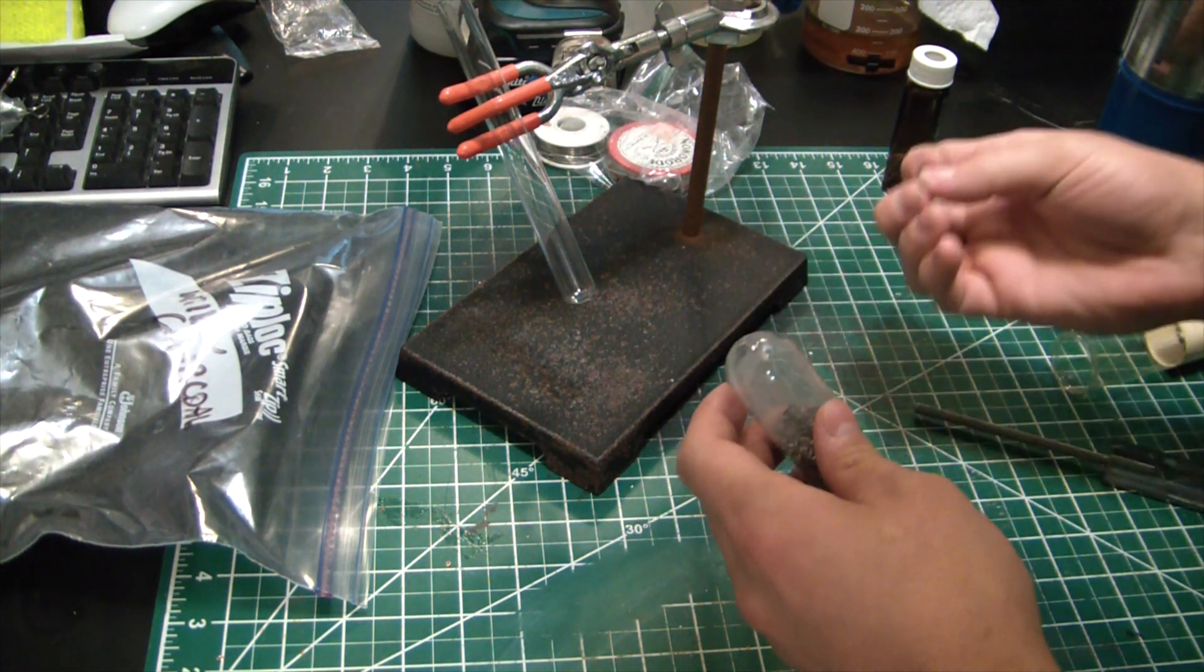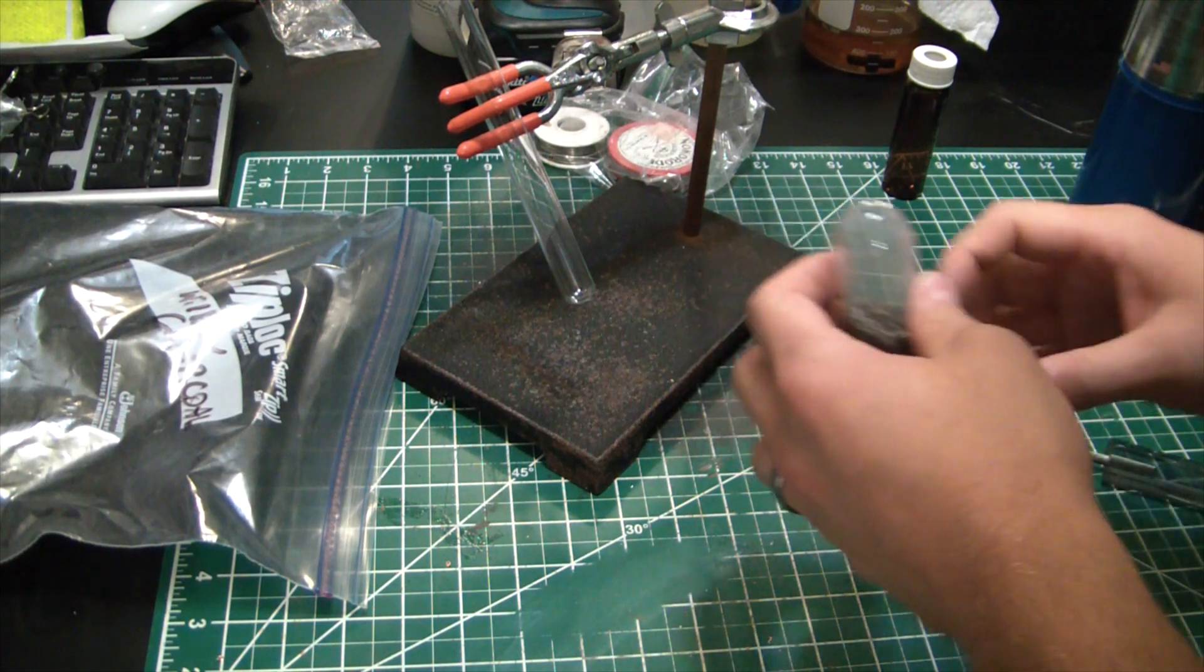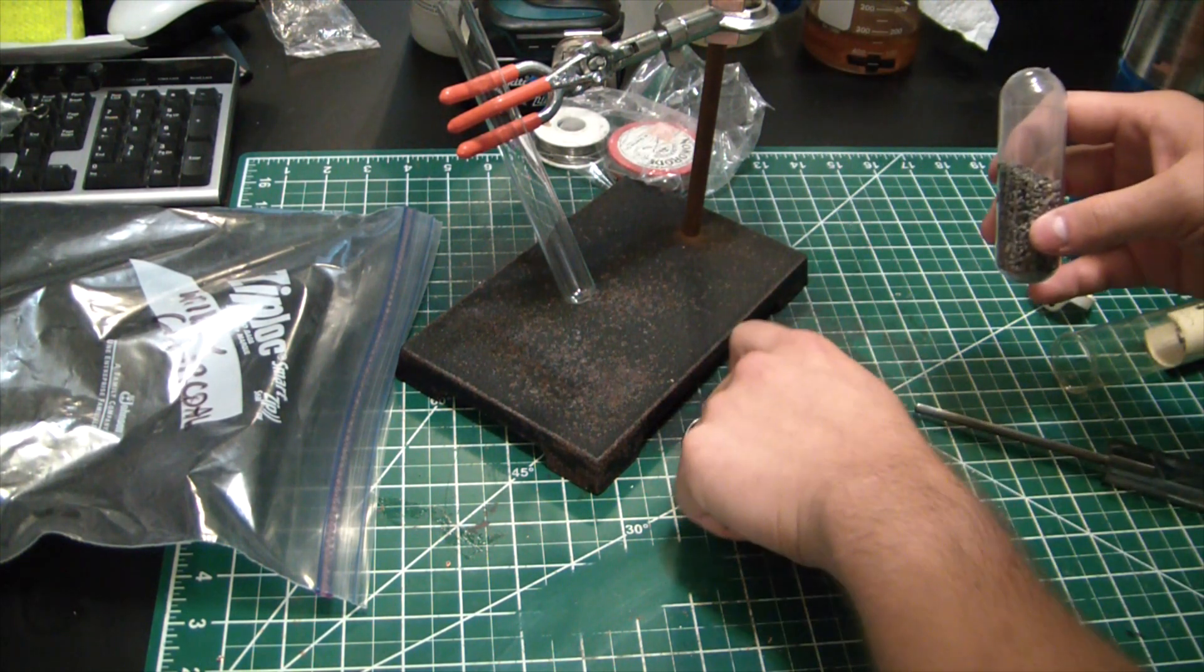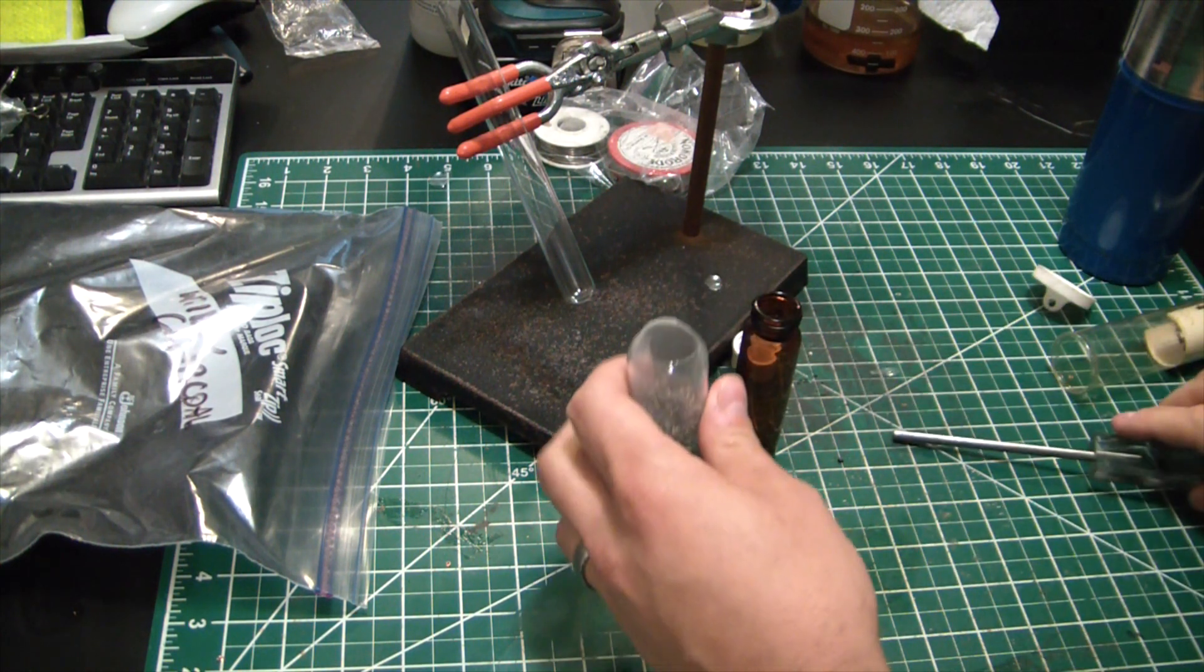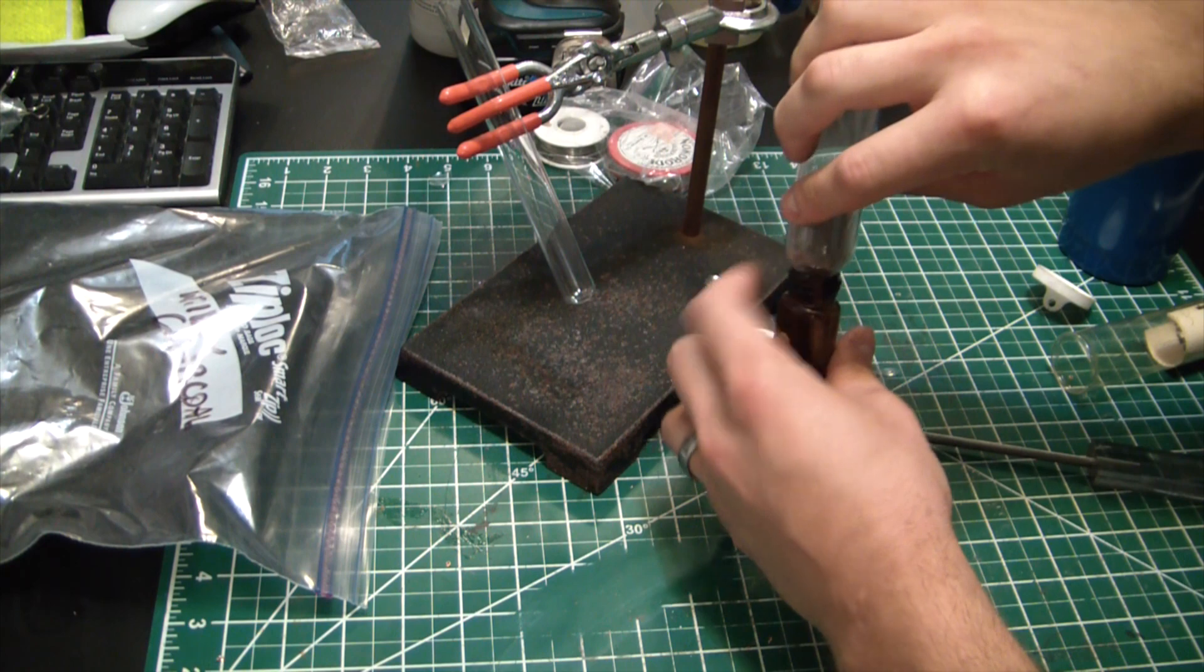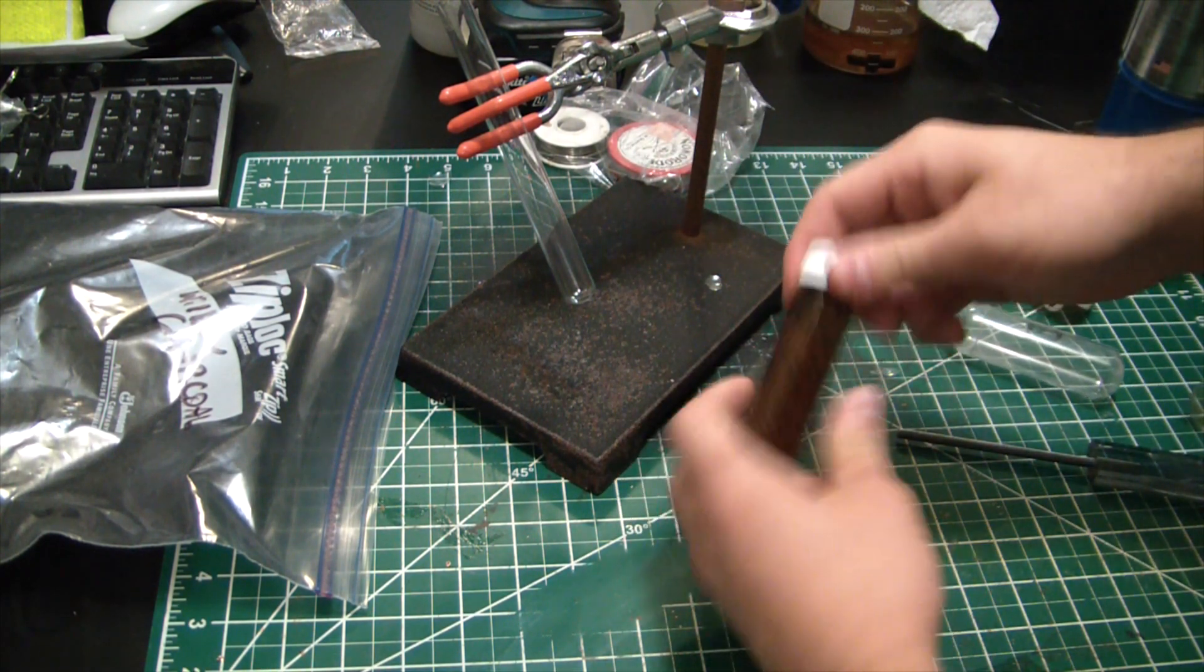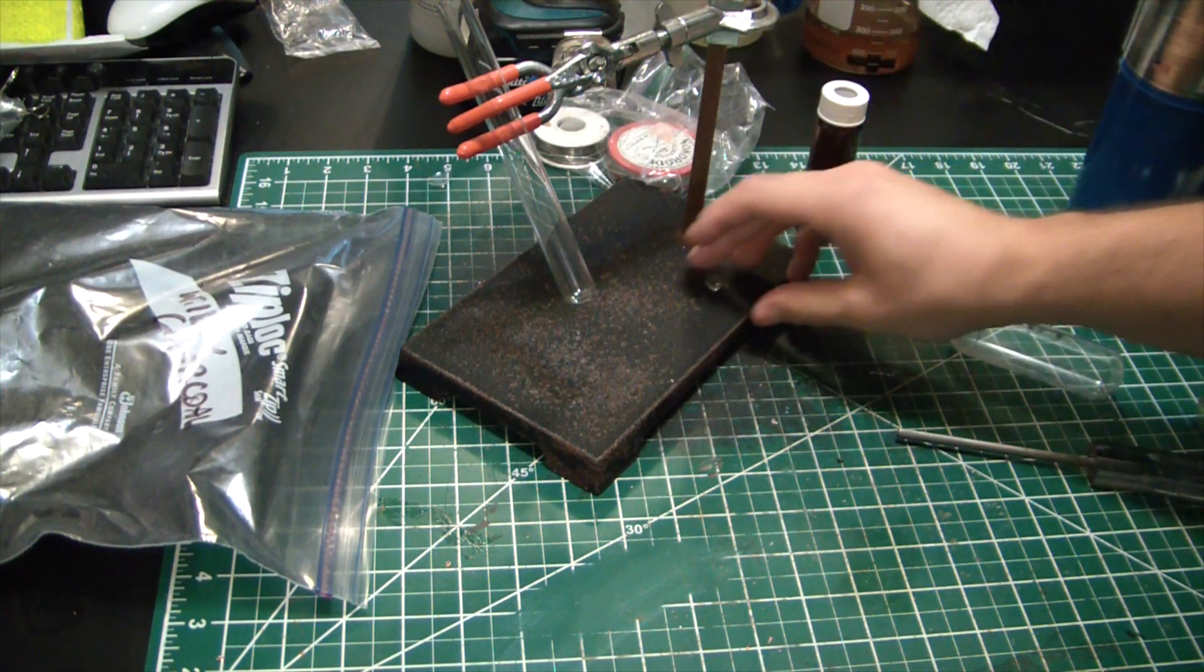All right, whatever. I'll try to pour it all in now, see if I can get it to break nicely. Yeah, well that works. My calcium metal is transferred into a nice airtight sealed vial here that'll keep it for good storage.